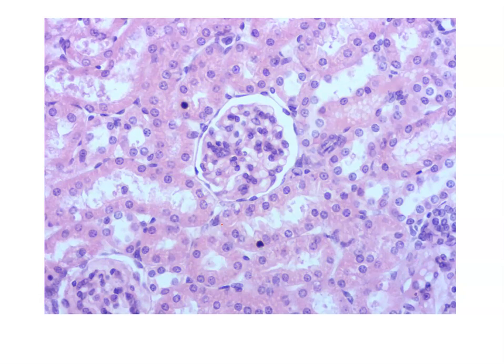The renal corpuscle is made up of 2 subparts. That includes the inner glomerulus. We said it looks like sort of a little puffball or a cluster of capillaries that bring in the blood to filter the blood to form urine. So surrounding this little puffball is a single layer of squamous-shaped cells. So this is our simple squamous epithelium that makes up what's known as the glomerular capsule or the Bowman's capsule. So simple squamous epithelium represented in our kidney slide.